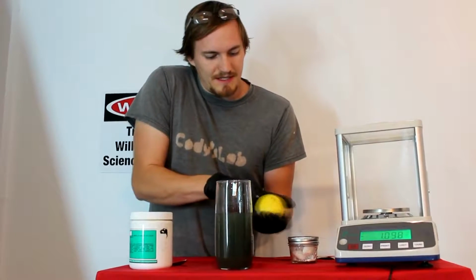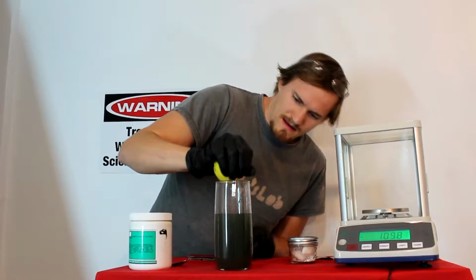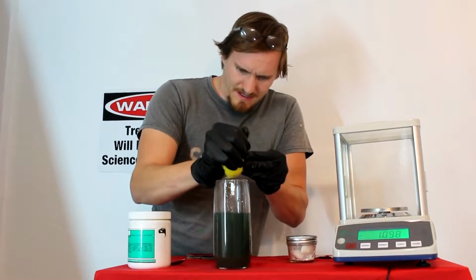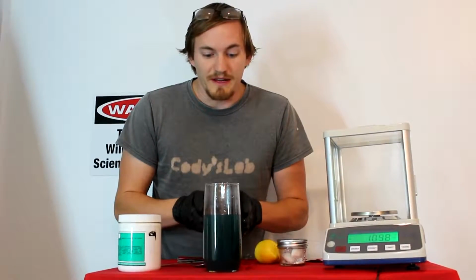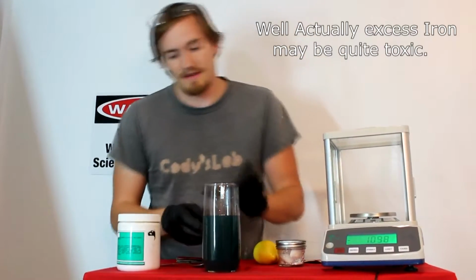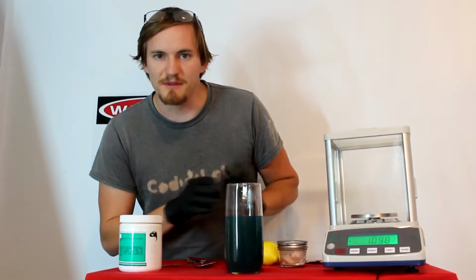Now to help the process along, I can add in a little bit of an acid, about a lemon. Give this a squeeze, put some of the lemon juice in there. That acidifies the solution, making the test more sensitive. There we go. That should be enough to detect that small amount of cyanide. As you can see, the solution has turned a nice bright blue color as the ferrocyanide is being precipitated from the solution. Now that coloring actually means that the cyanide's been completely destroyed and is now completely safe and non-toxic. In fact, that coloring was once used in blueprints for the blue ink.